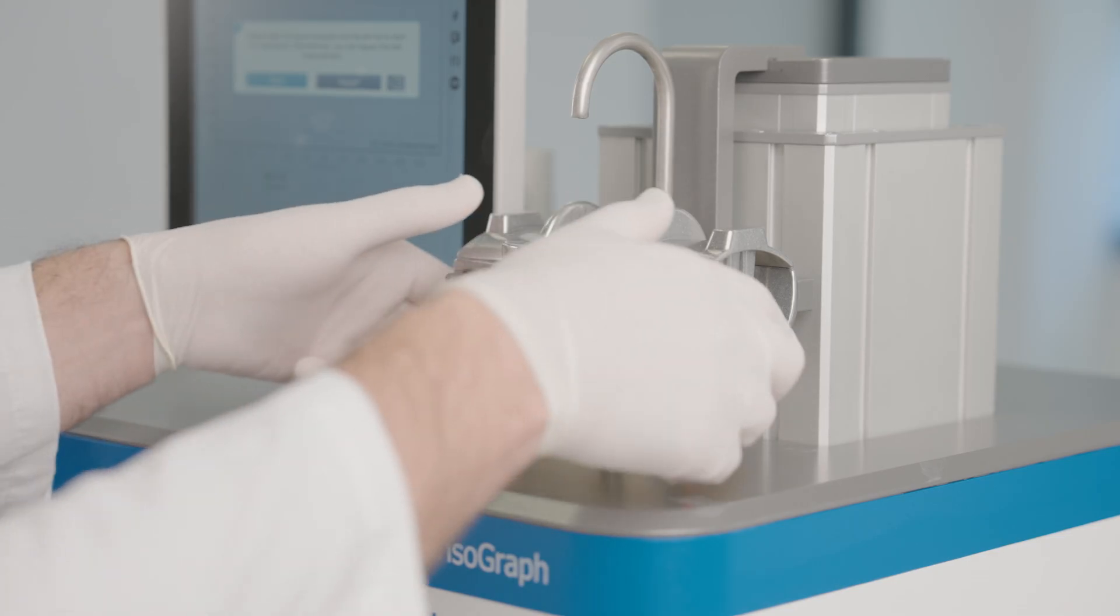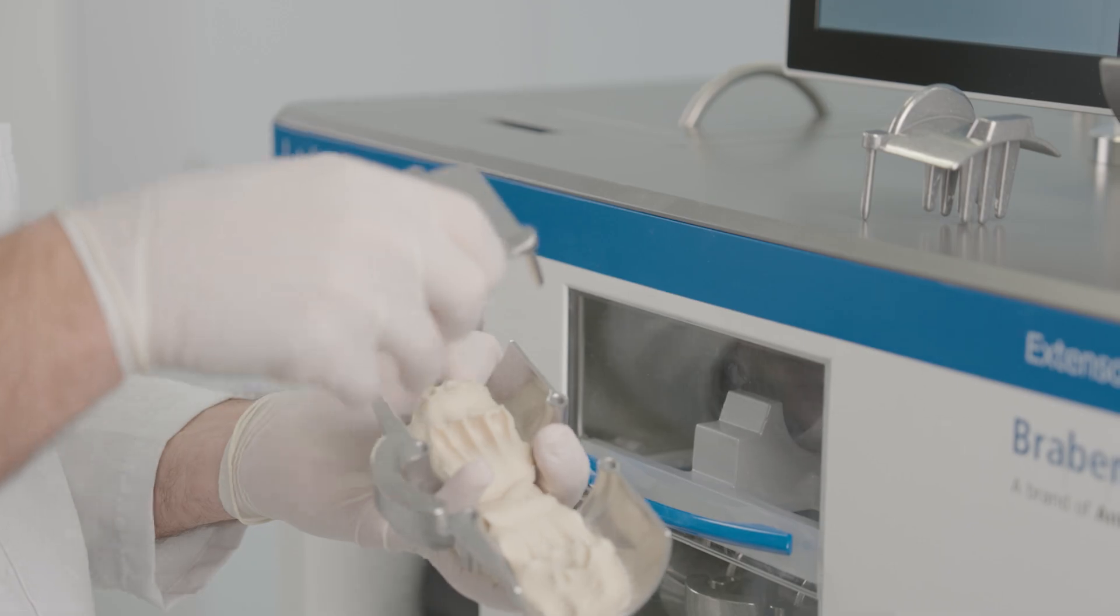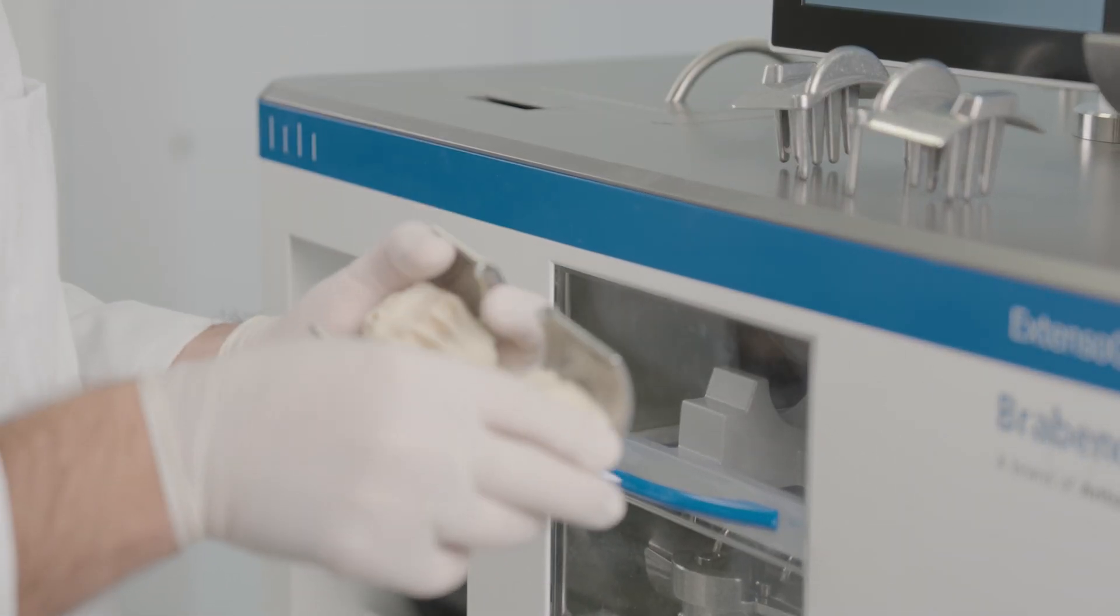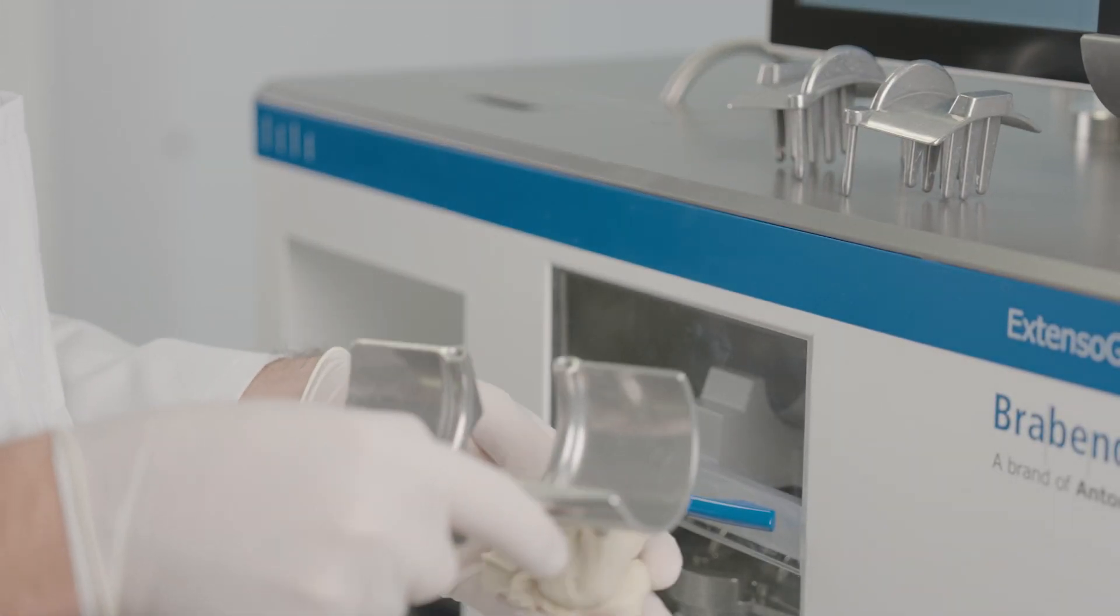Remove tray, dough, and clamps after measurement. The second piece of dough is ready by the time the first dough is stretched and prepared again.